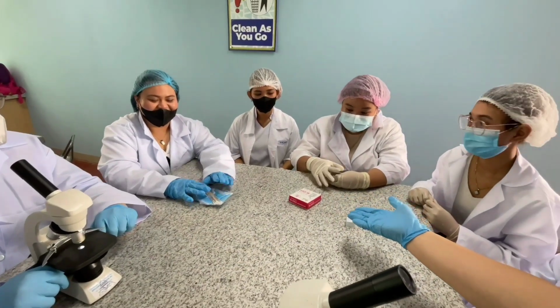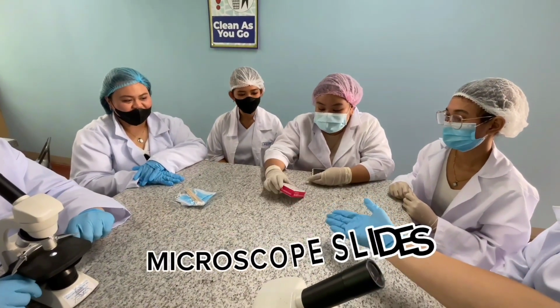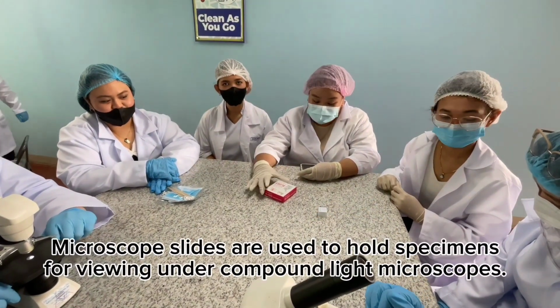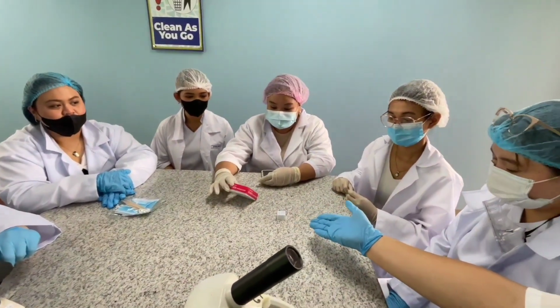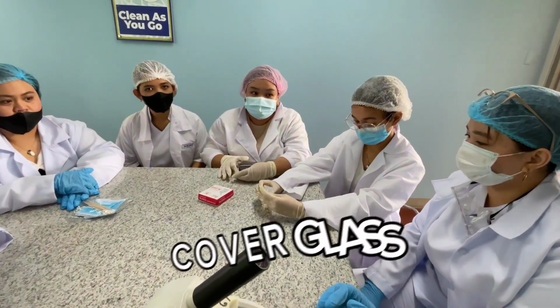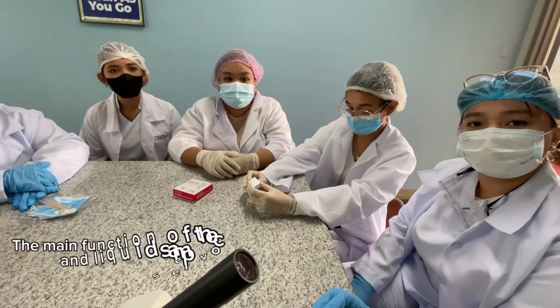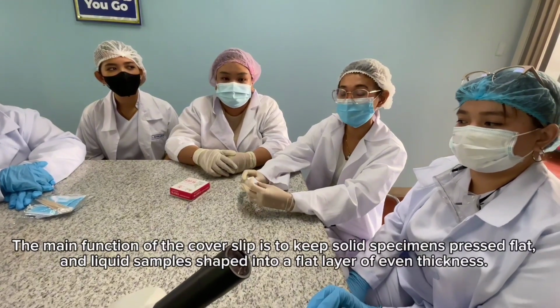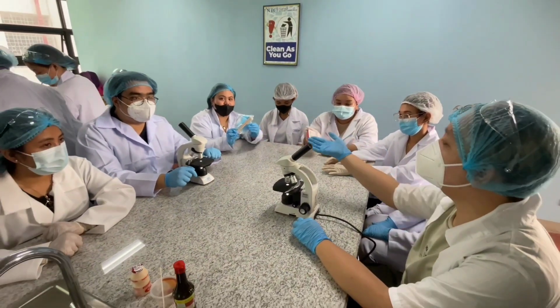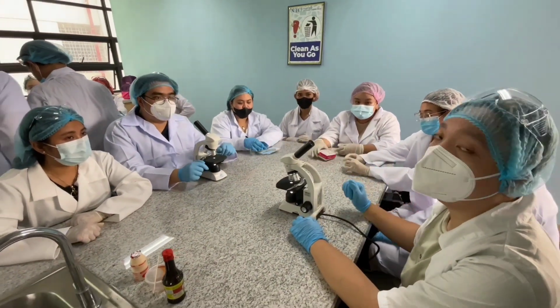And we also have, what is this? This is a microscope slide. The cover glass holds the specimen in place and protects it from contamination. Those are our small materials. And of course, without them, we cannot continue our experiment.